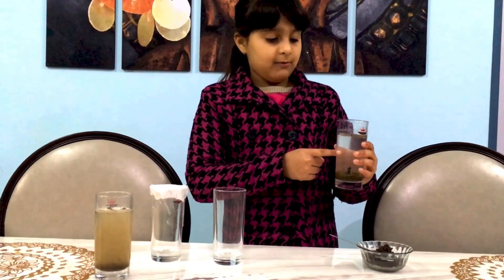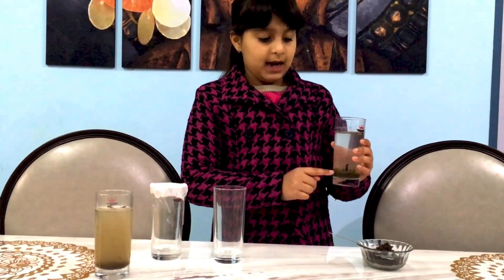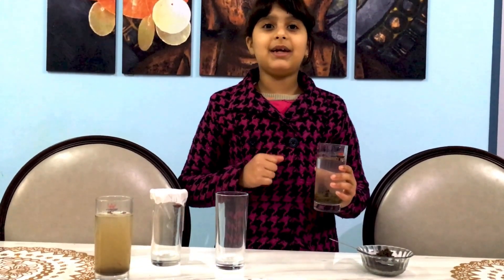So this liquid here you can see is known as supernatant liquid. And the impurities which have settled down are known as sediment. And the whole process is known as sedimentation. So sedimentation is the process in which the impurities or sediments settle down.